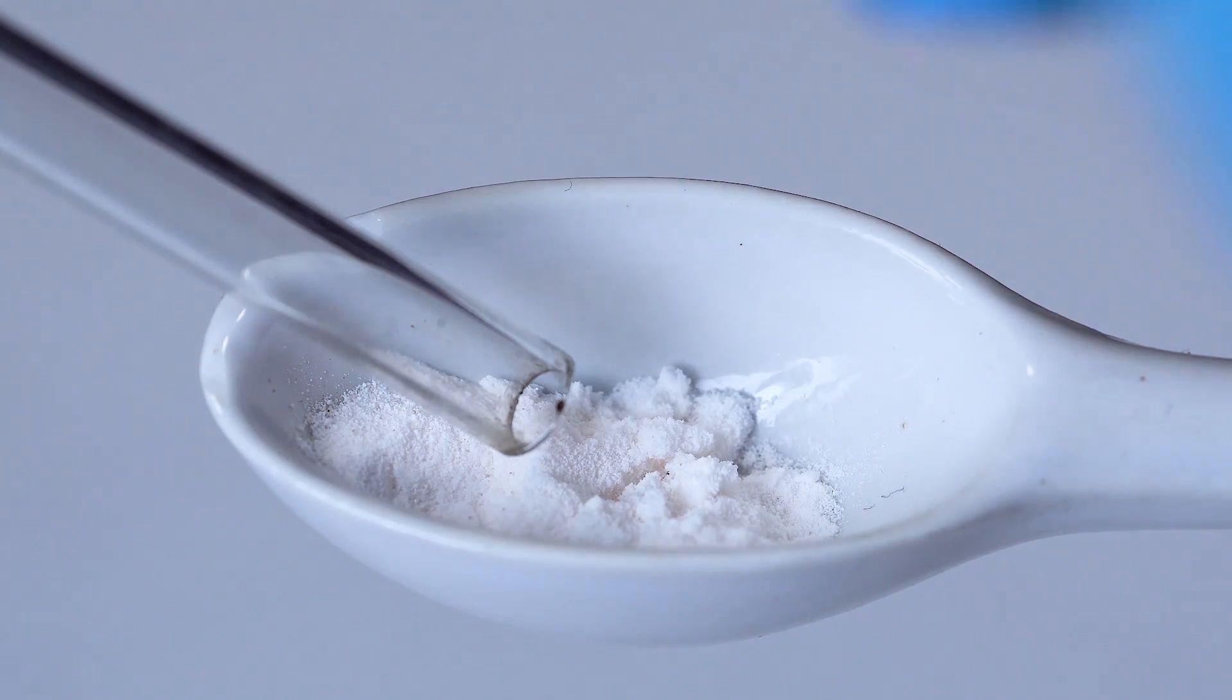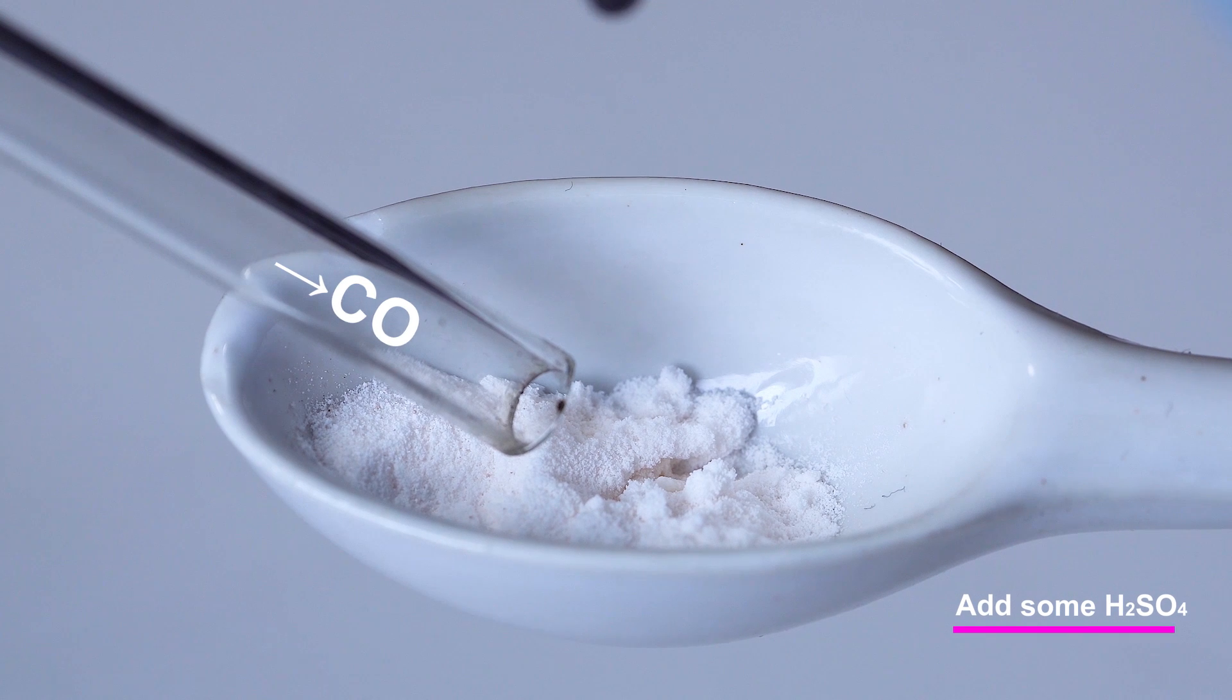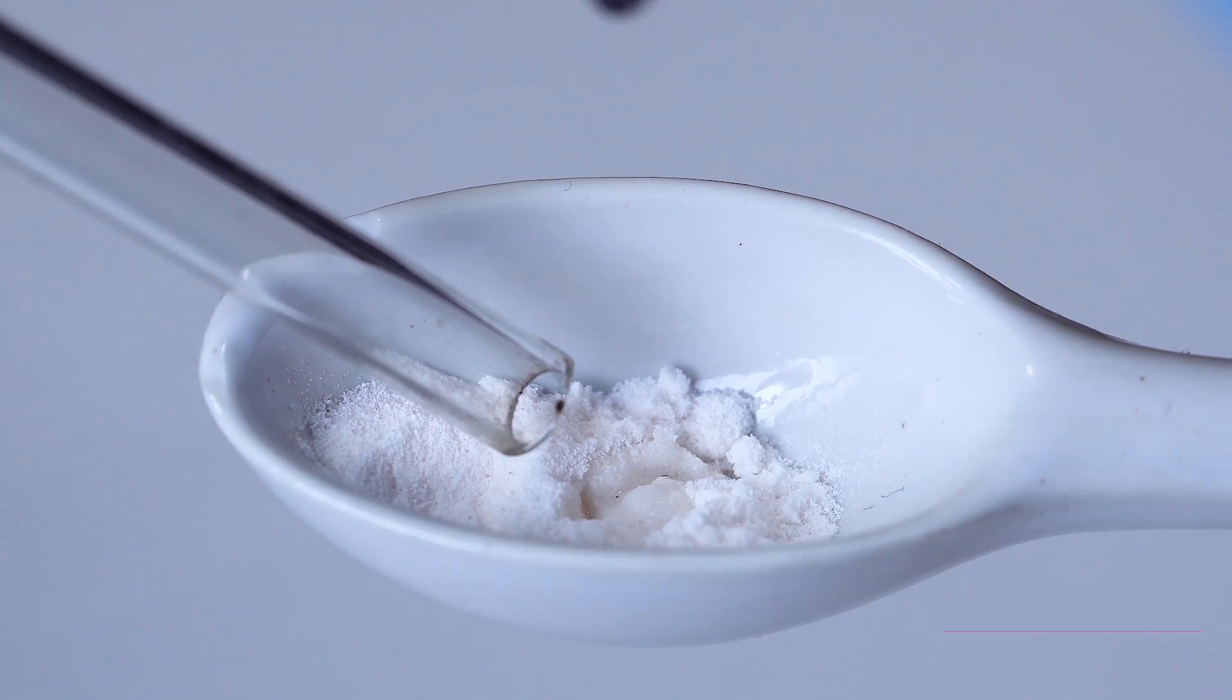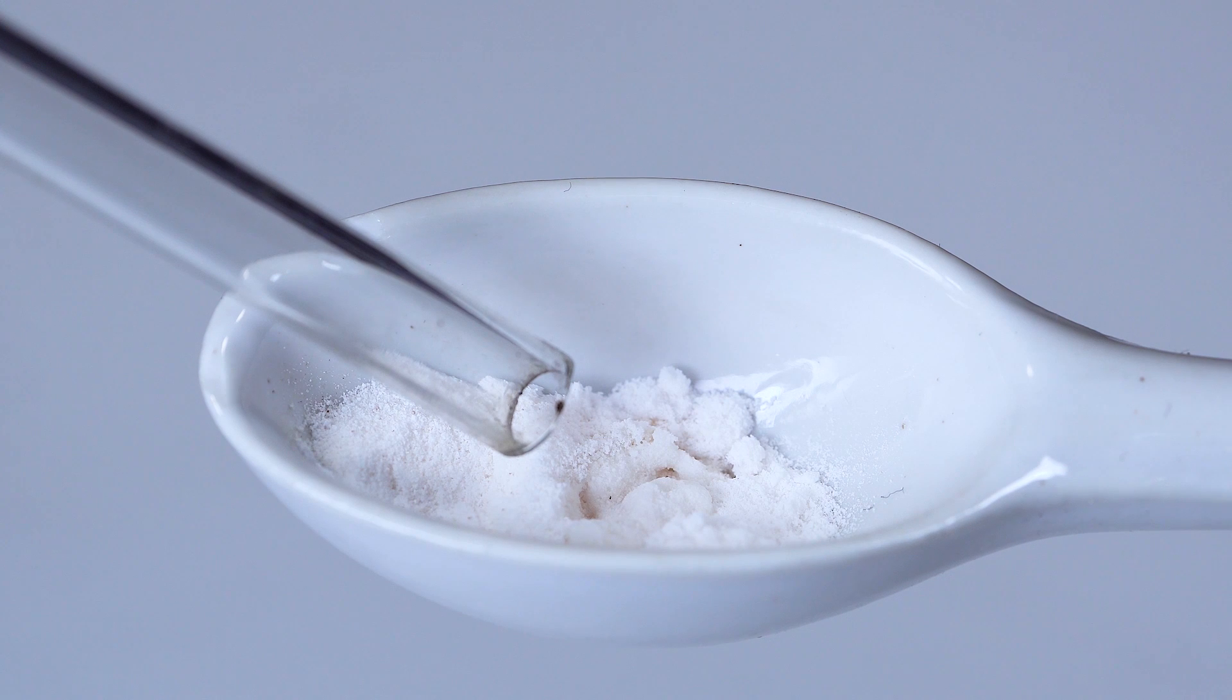But only freshly prepared iodine pentoxide can react at room temperature. If it was stored for a long time, carbon monoxide may not react that easily. In this case, to start a reaction, iodic anhydride needs to be reactivated with a drop of sulfuric acid.